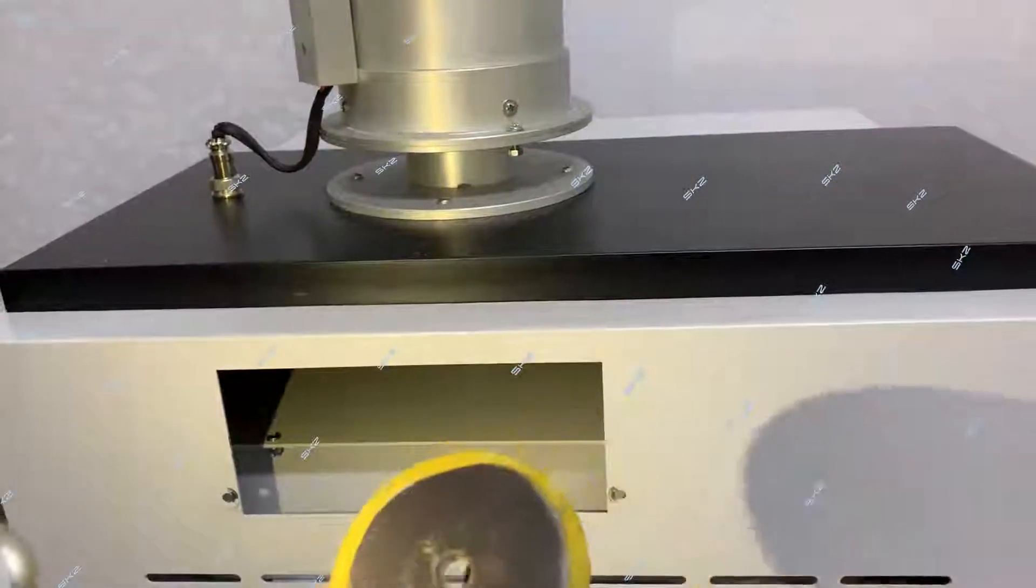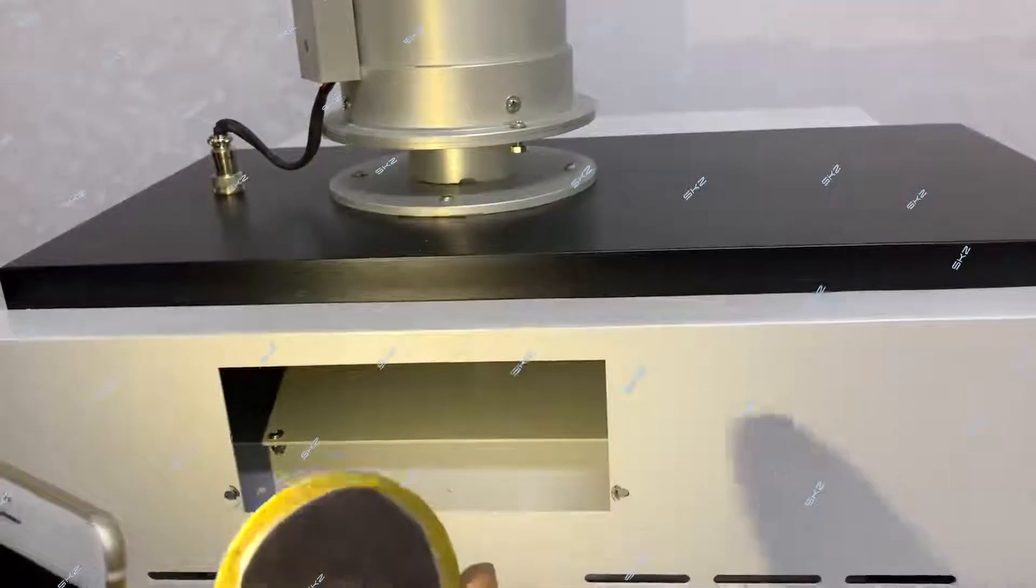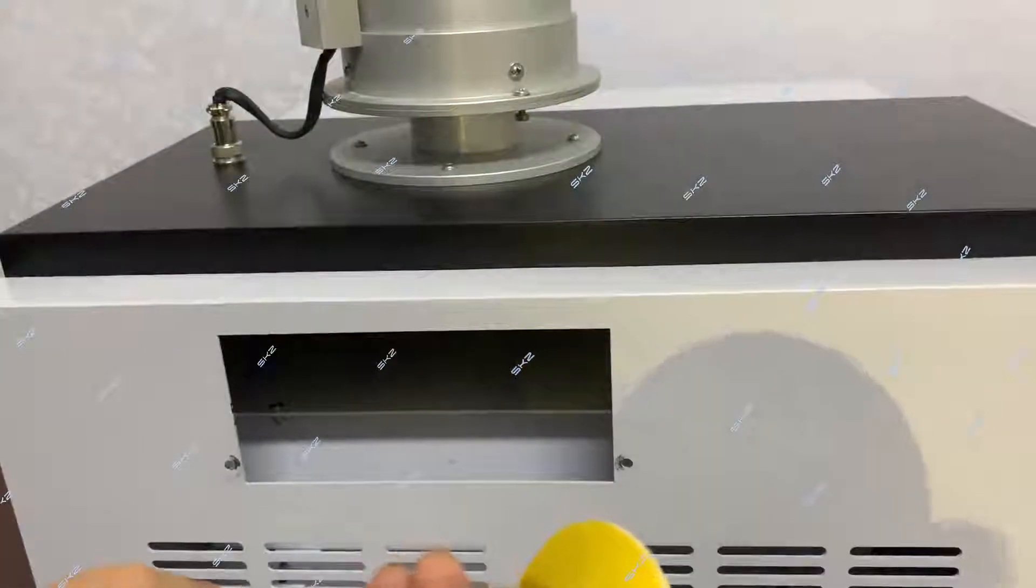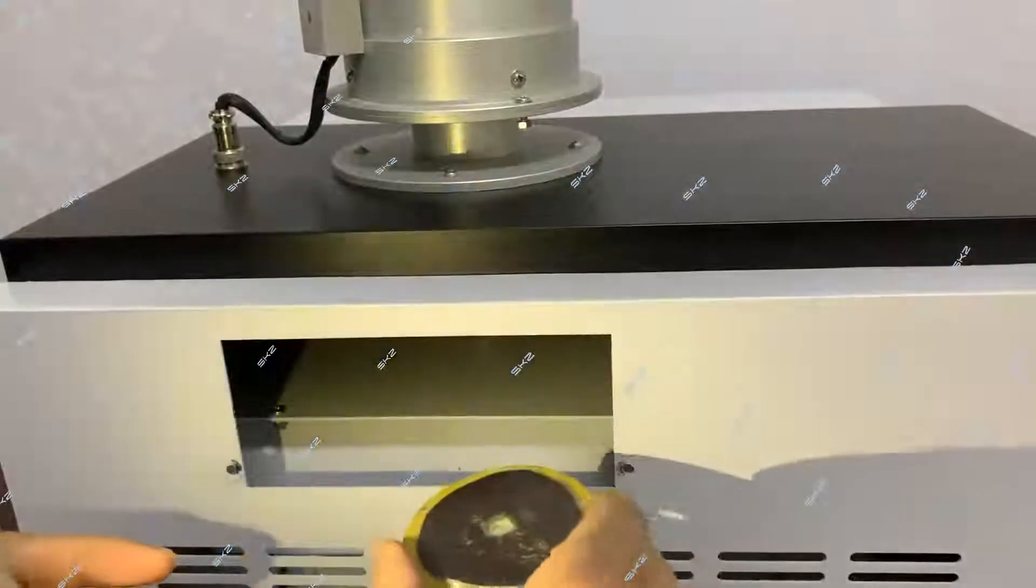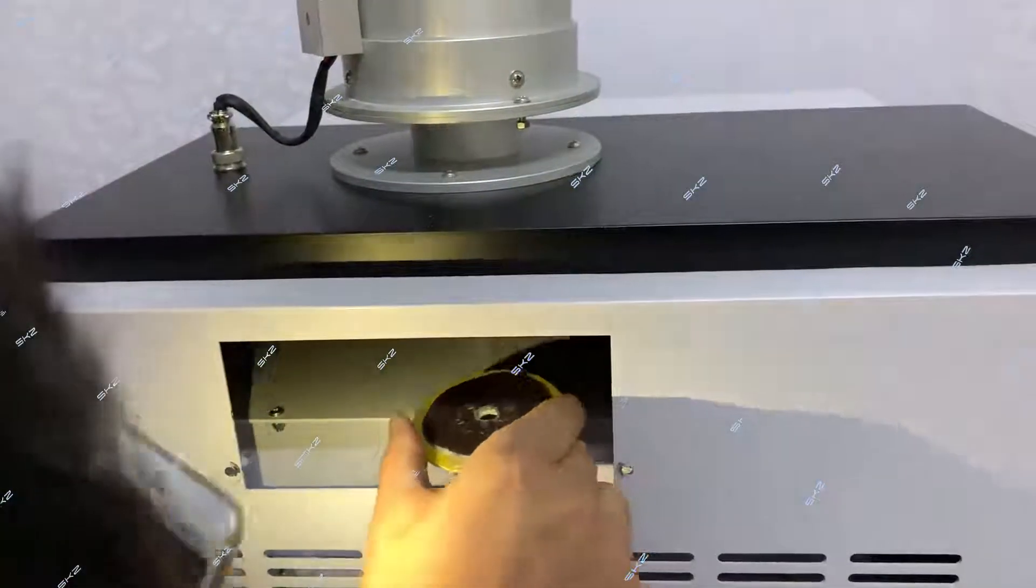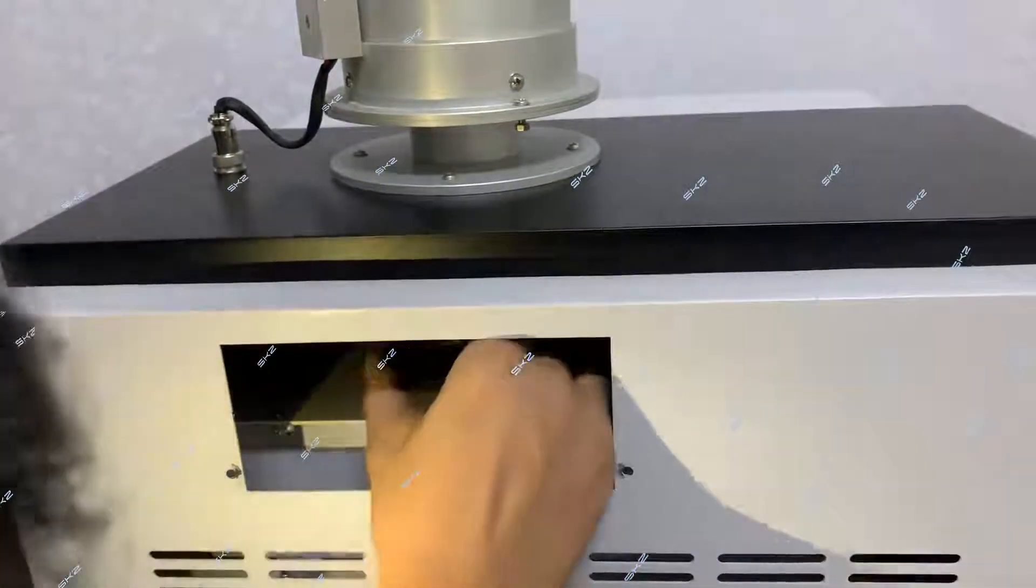This is the weight block. The yellow side should be forward, down. Now we put it inside.